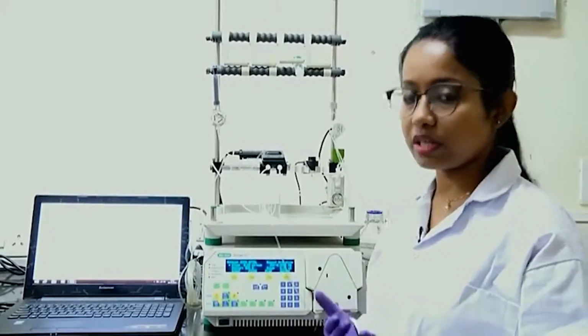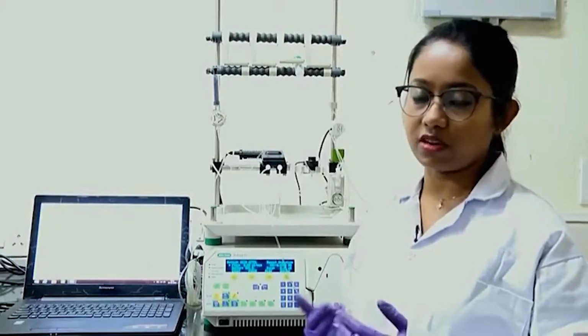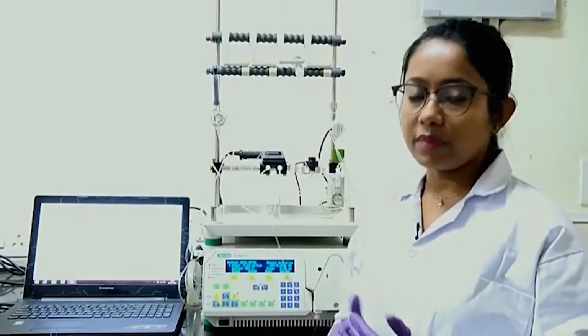So, when you use a lysis buffer for isolating your protein from cell lysate, we have Tris at around 100 millimolar, which has a pH of around 8.2, and 200 millimolar of salt. In this condition the protein is happy, though it will depend on your own protein. So, in this condition your protein is there. Along with this Tris and NaCl, we also have 10 millimolar of imidazole.